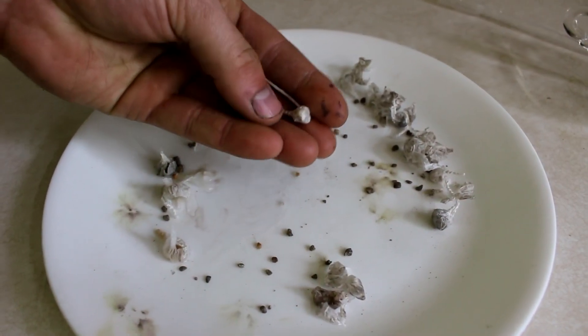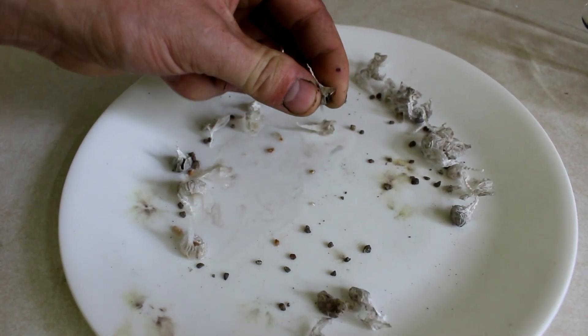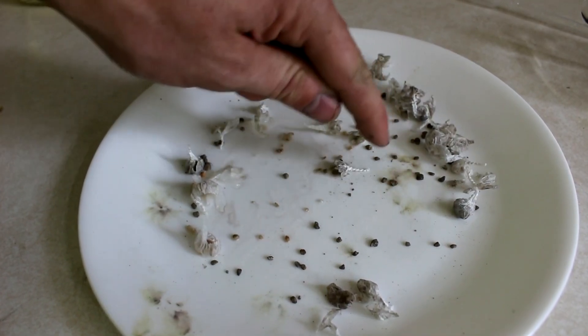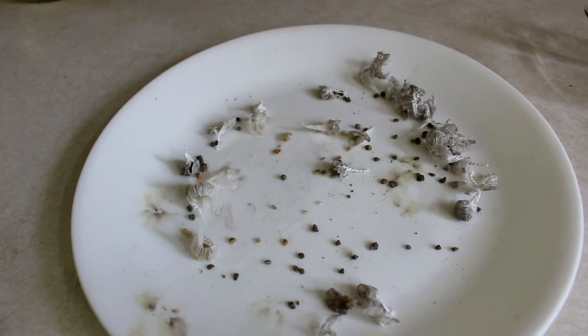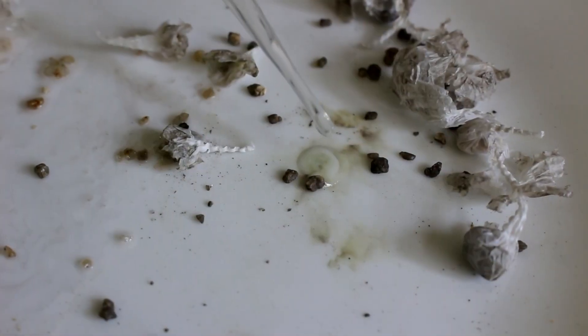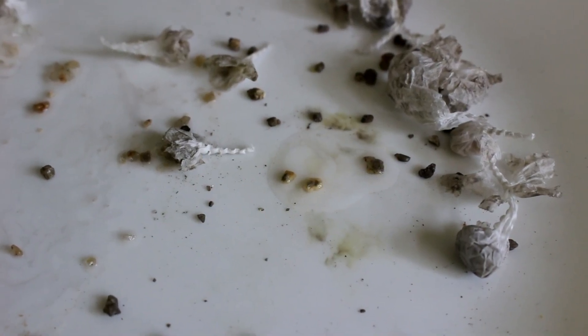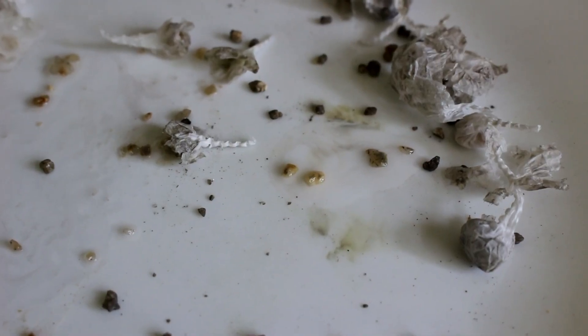So these little things, known as bang snaps, snappets, or poppers, contain a little bit of high explosive. The explosive is supposedly silver fulminate. If so, these stains should actually be primarily silver. So let's put a little bit of nitric acid on here and see if that's true. Okay, looks like it became lighter in color. That means the silver was dissolved, which confirms that it is silver.